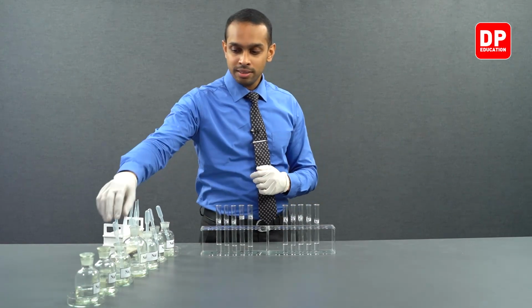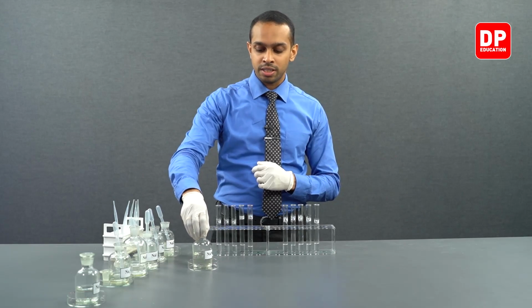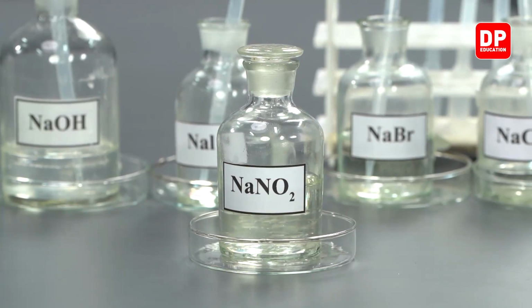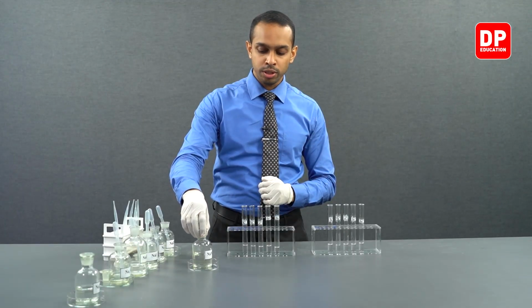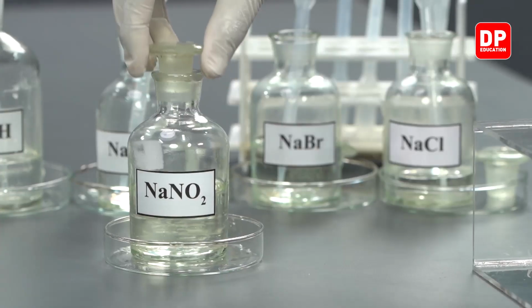Let's take a look at what happens when we react each of these cation solutions with nitrite ions. To introduce nitrite ions into our cation solutions, we are going to be using sodium nitrite.